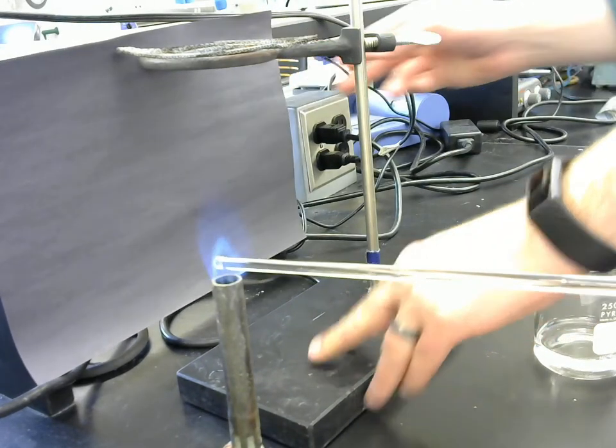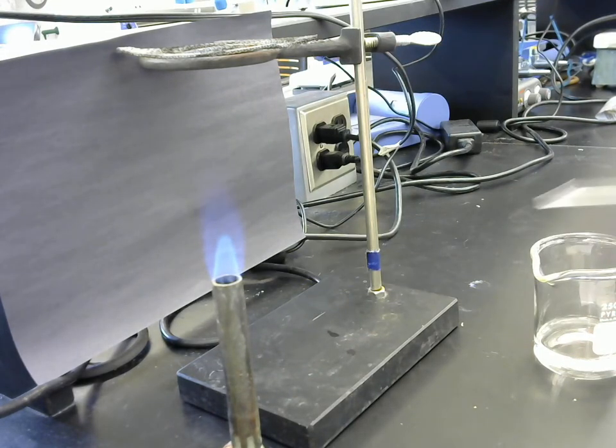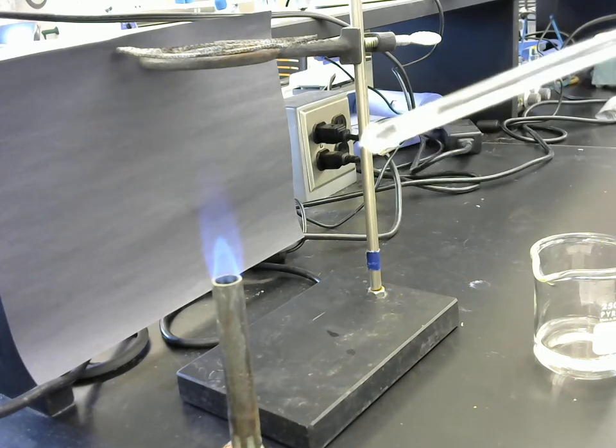Right, a little bit. Okay, now get the stir rod wet again, so stick it back in that deionized water. Yep. Okay, and dip it into the powdery stuff. I'll show that to the camera. So there's lots of the solid on the end of the stir rod.